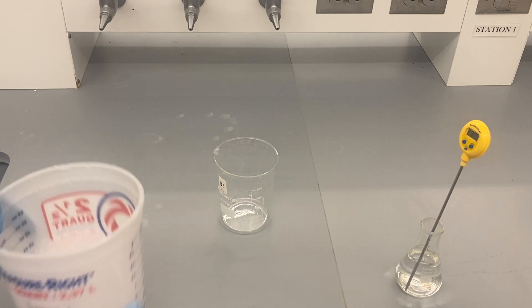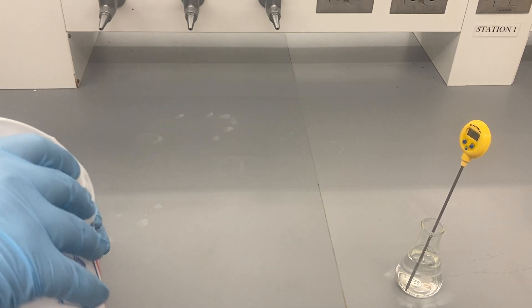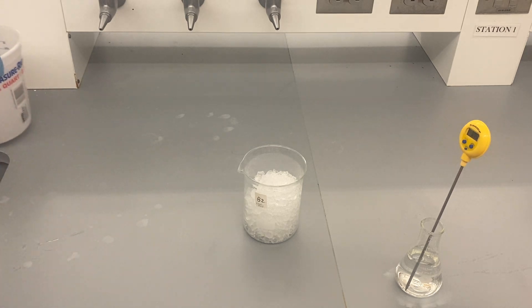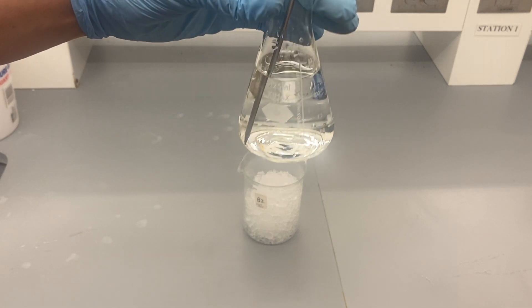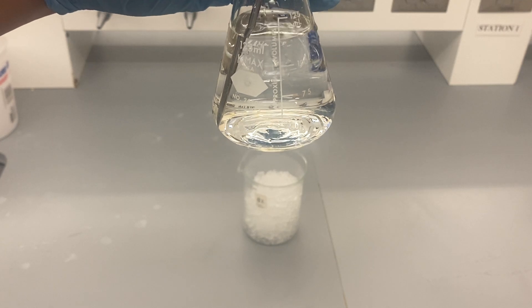So here I've got some ice I'll pour into a 600 milliliter empty beaker. And then you see here we're using an Erlenmeyer flask — it's a 125 milliliter Erlenmeyer flask. We've got it filled up to probably 115 milliliters or so.